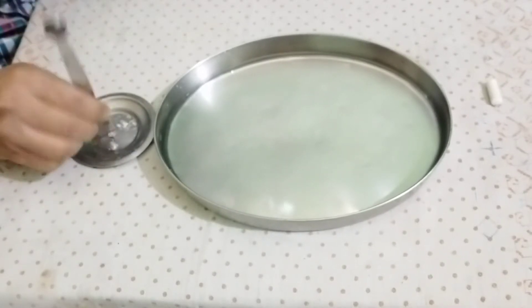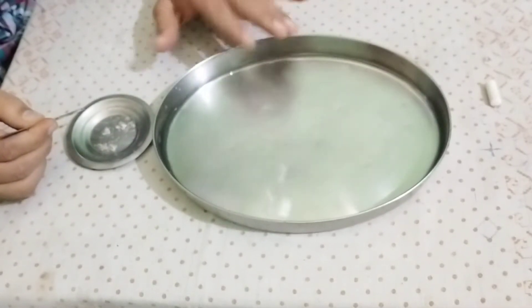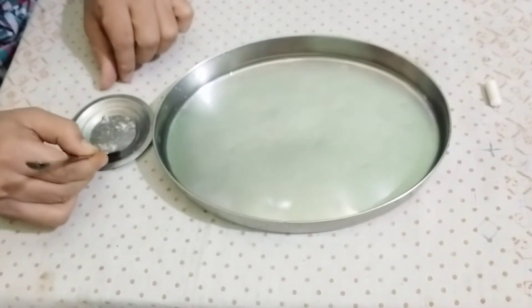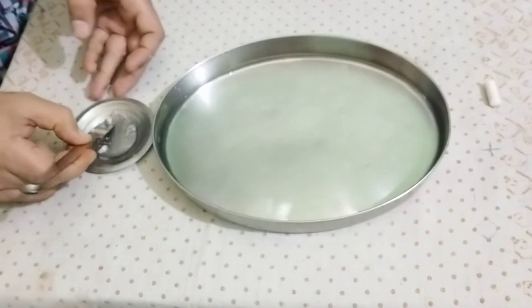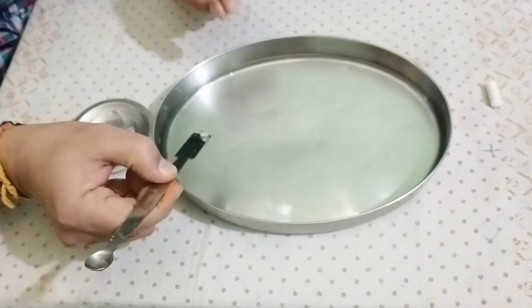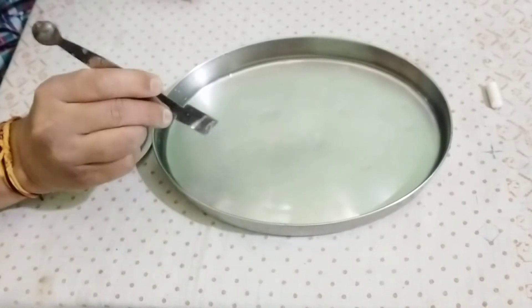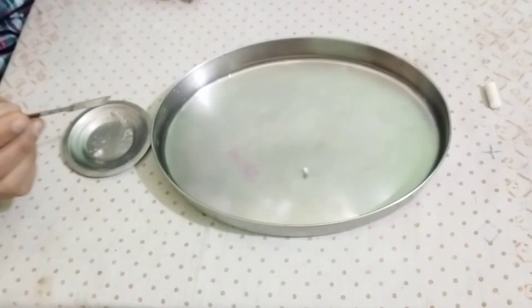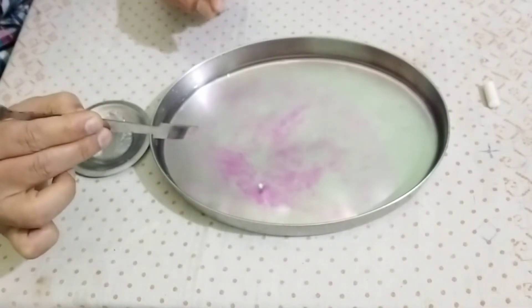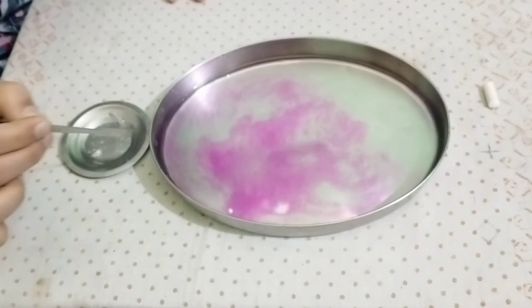What I am going to do is that I have taken water in this container, and along with the water I have added an indicator — which you have to identify. I am now going to drop the sodium metal into this water containing the indicator. Just observe carefully what is going to happen. Sodium metal is floating on water. The reason is very simple: it is lighter than water, that is, the density of sodium is less than the density of water.